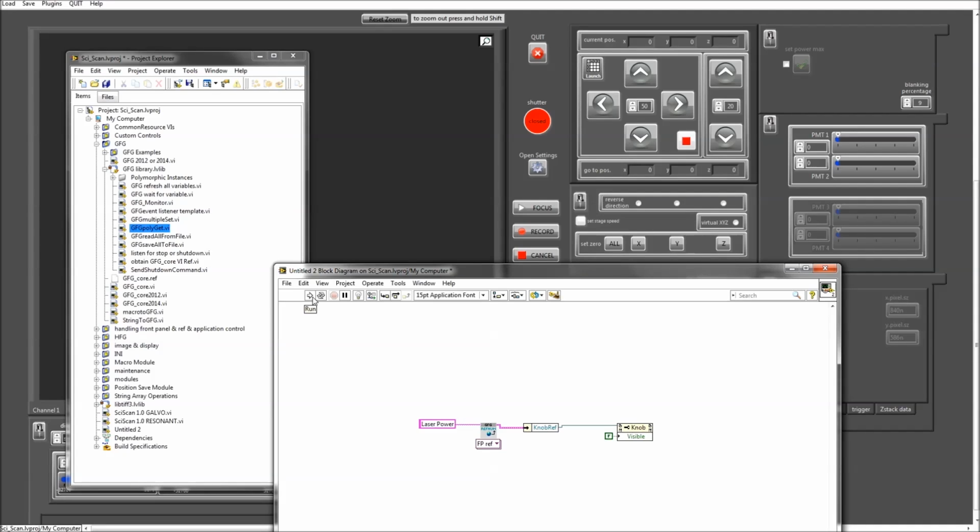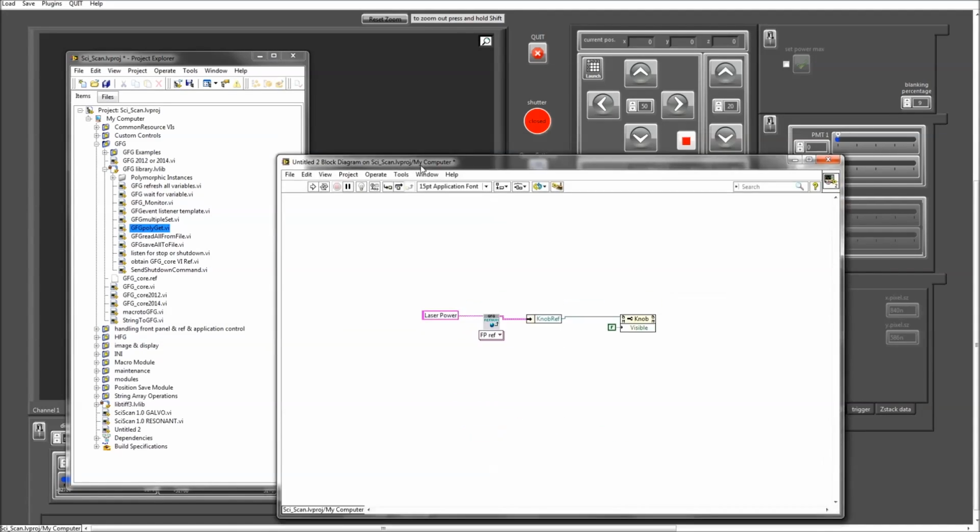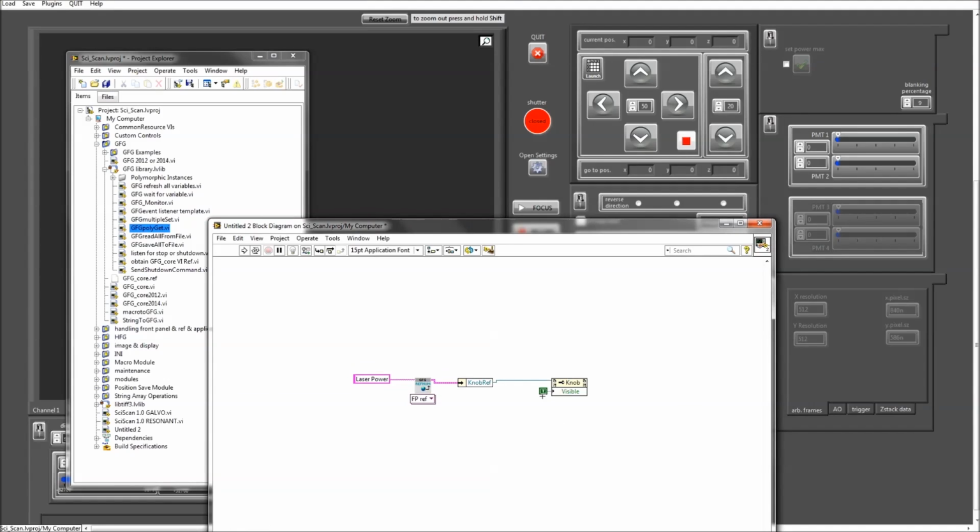I have full control over any of these front panel elements from a standalone VI that I haven't even saved yet. So that is quite convenient, in that you don't have to do any of what I tend to call forensic programming, trying to understand all the code that someone else has written. You have direct access to anything you see here, and anything that you can do manually, you can do programmatically, and obviously much more, as you can see here, with making invisible a front panel element.